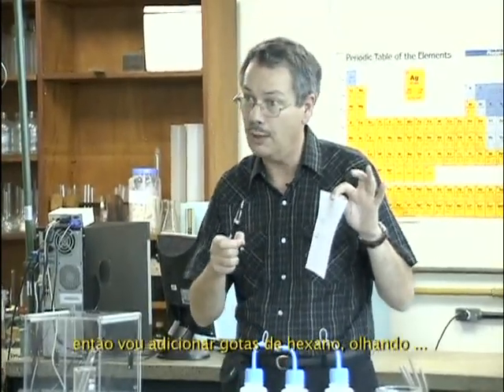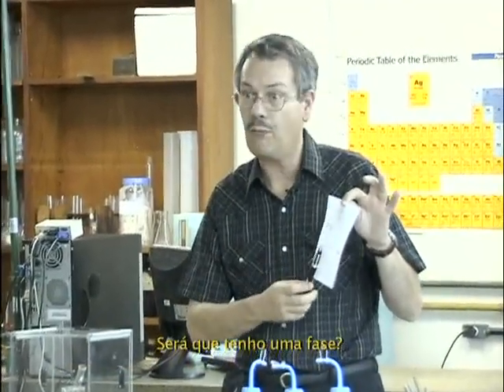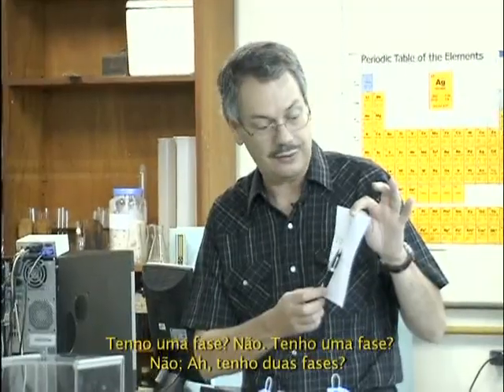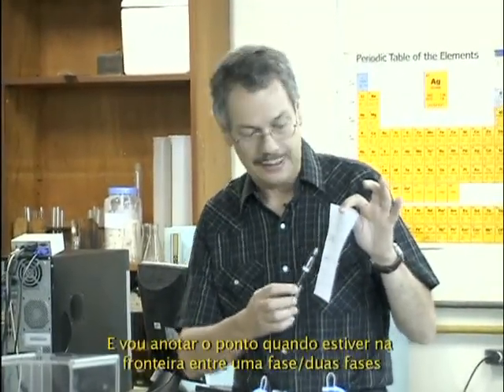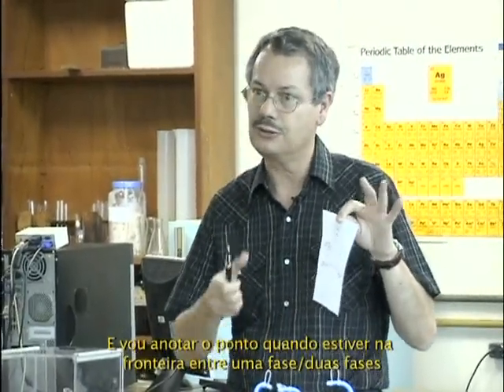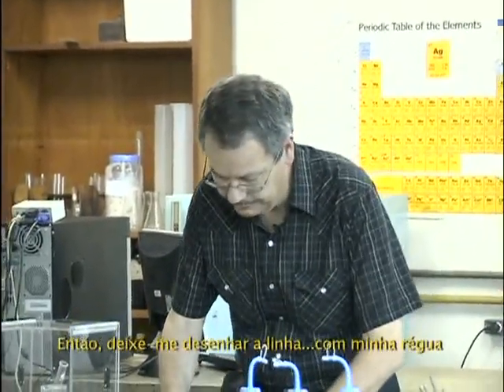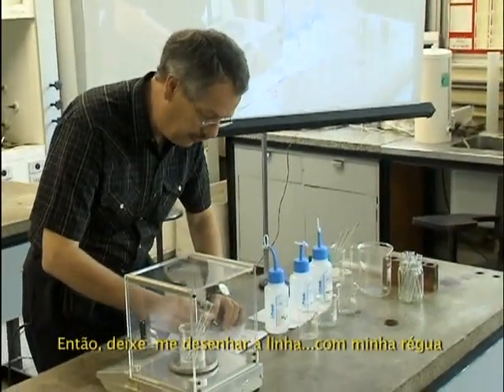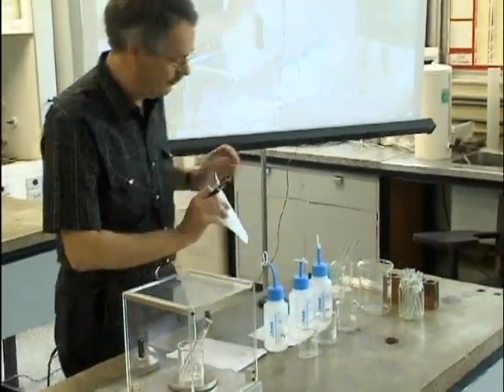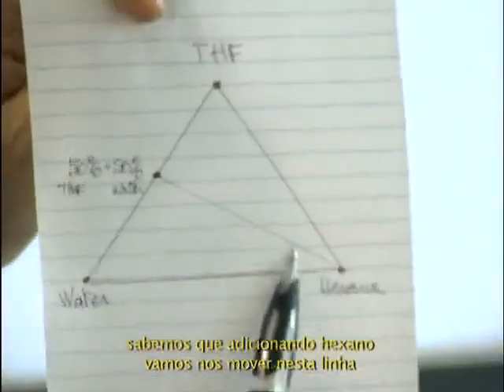So I will add drops of hexane, just looking with my eye. Do I have one phase? I am in a one-phase zone. Do I have one phase? No. I am in the two-phase zone. And I will write down the point when it goes from one phase to two phases. So let me draw the line with my ruler, special ruler. We know that adding hexane, we will move on that line.